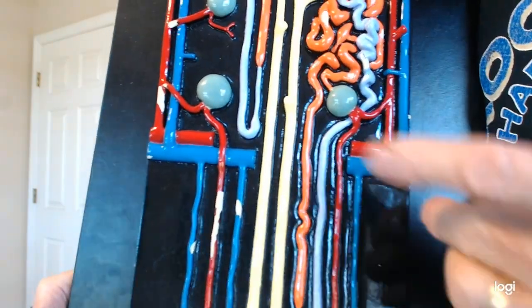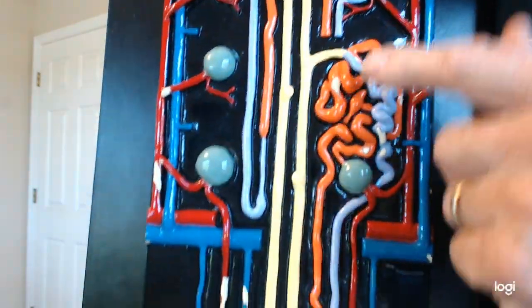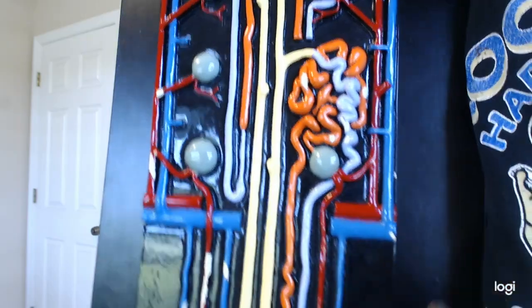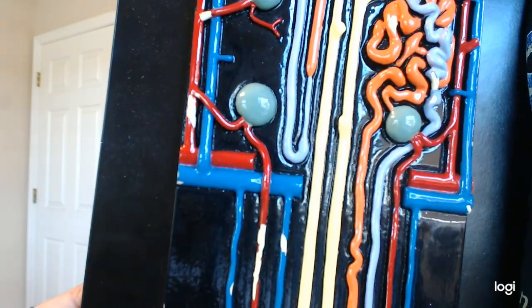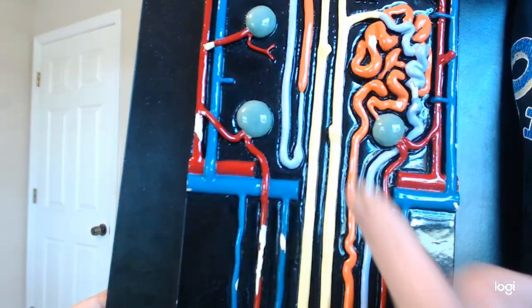So it's easy to remember: the proximal tubule is connected to the Bowman's capsule. The distal tubule is connected to the collecting duct. So, although I'm looking at it upside down and backwards, you ought to be able to tell, if I give you a really good close-up picture, which one is which. If it's coming out of the glomerulus, it is the proximal tubule. If it's going into the collecting duct, it's the distal tubule.